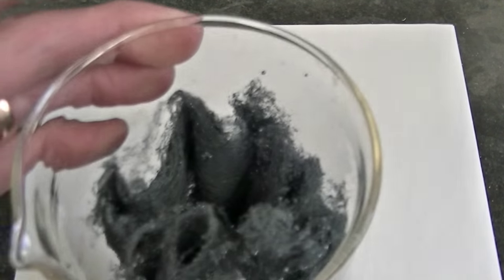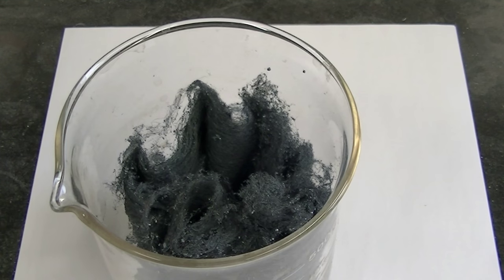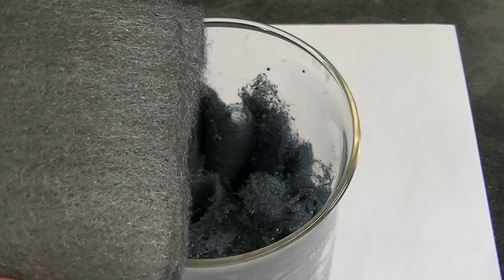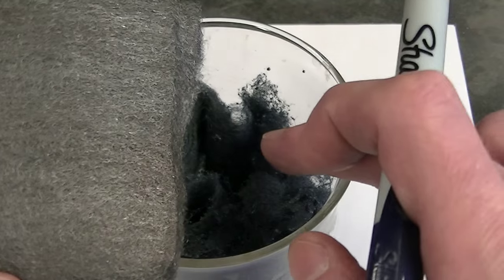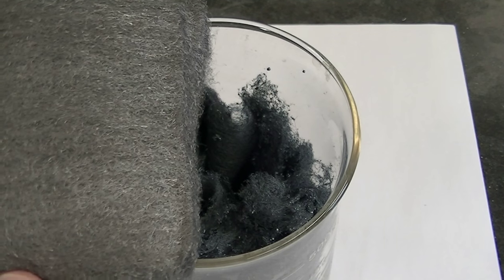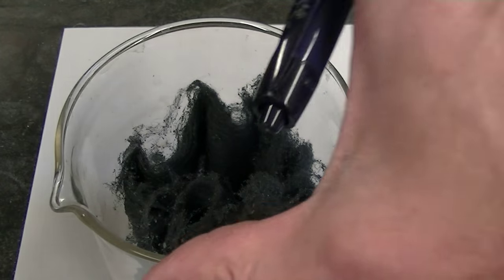We're going to go ahead and analyze the results of our experiment. You might remember that we produced some iron oxide by burning some steel wool. It's interesting to look at the difference between the two. There's the steel wool, which has a nice gray color, whereas the iron oxide has kind of got like a bluish black color. So we can tell that there's a chemical change that's occurred. We're going to go ahead and analyze this stoichiometrically.